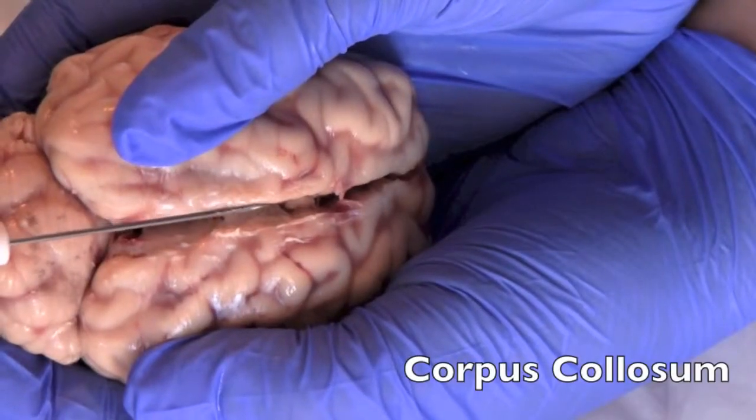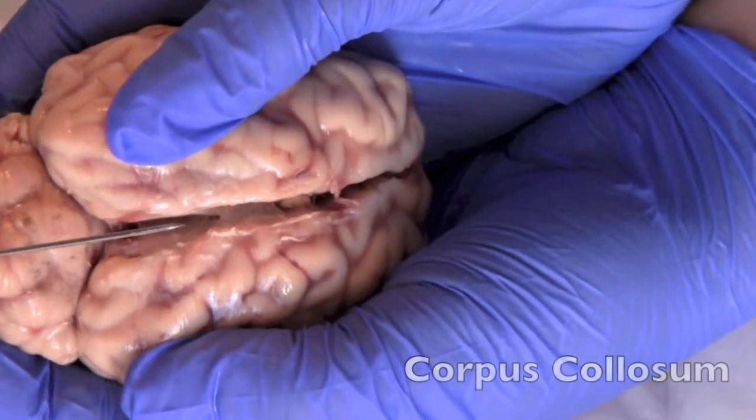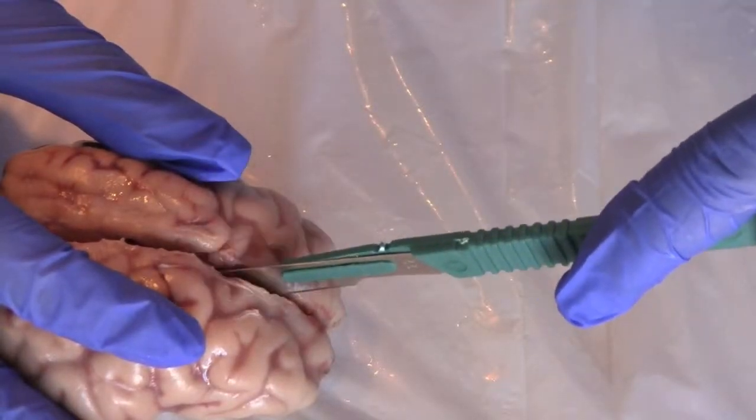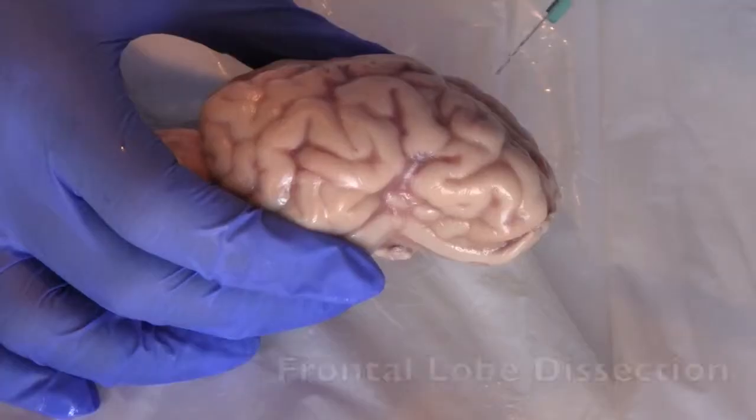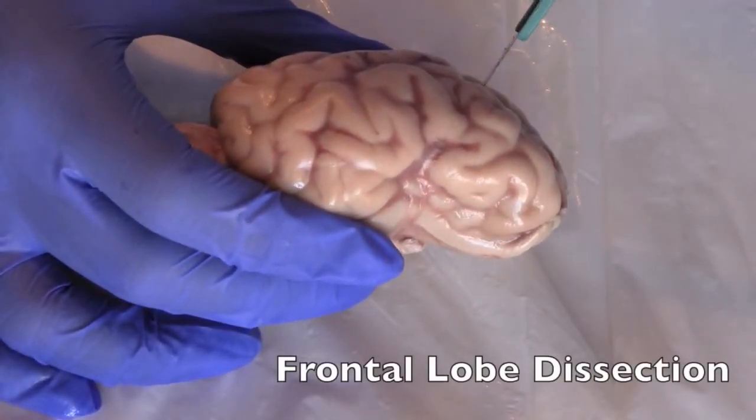Here's the corpus callosum, which connects the left and right hemispheres. Now we are going to cut through the corpus callosum. From here we are going to cut through the middle of the frontal lobe.